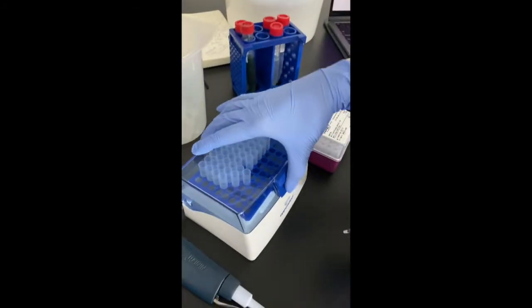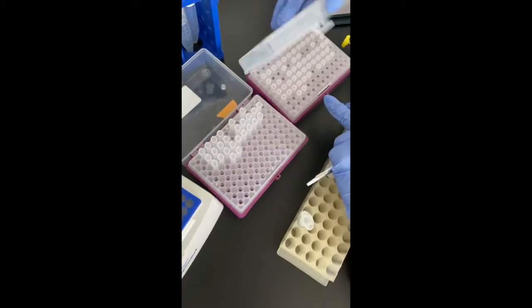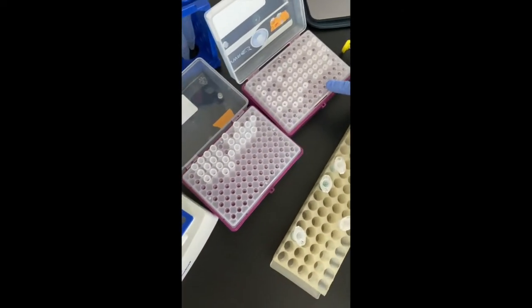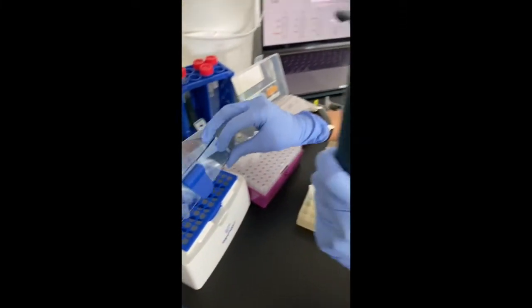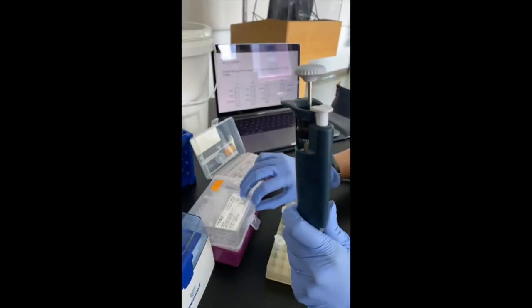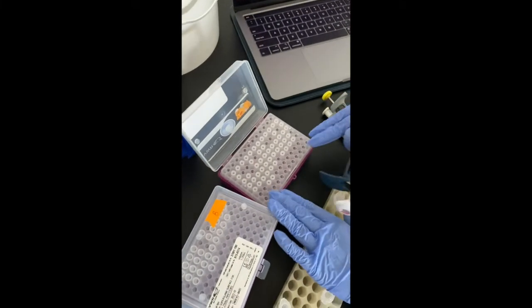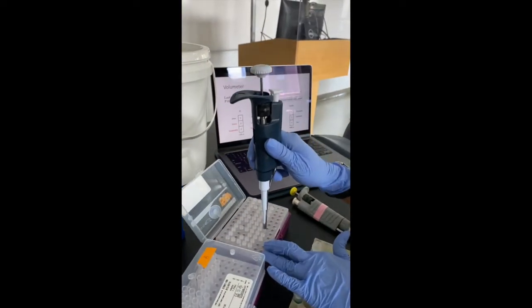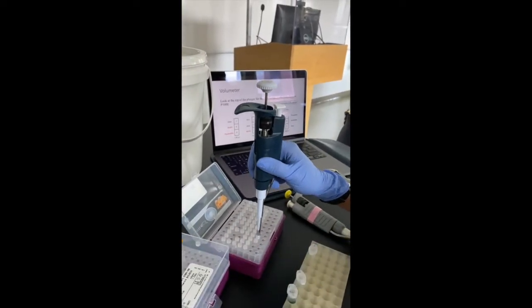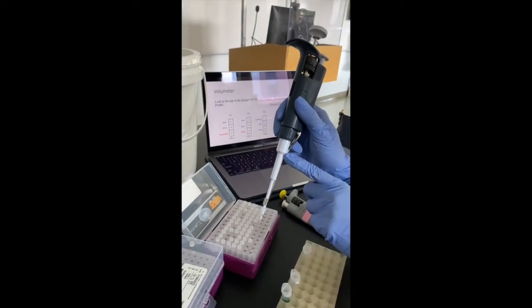So the next step after you've set a specified volume is to choose the right set of tips that goes along with the pipette. So you have 3 sets of tips: the smallest one, the medium-sized tips, and the large set of tips. For P2, the tips that go along with this micropipette is the smallest set of tips. Once you've identified the set of tips that goes along with the micropipette, you just insert the micropipette into the tip box, apply slight pressure, and you've inserted the tip into the micropipette.